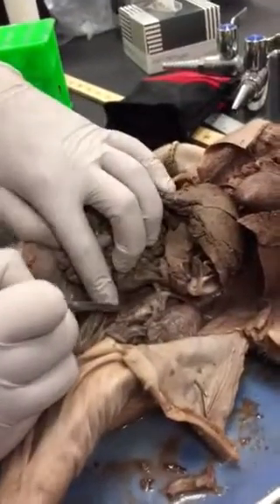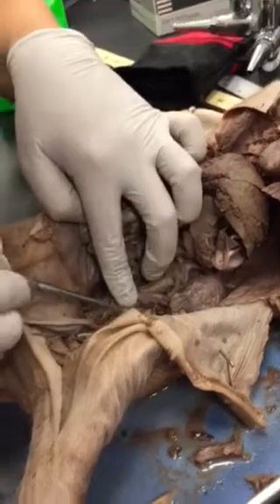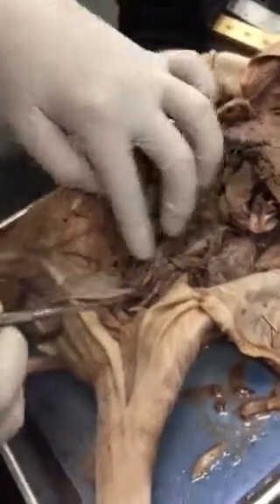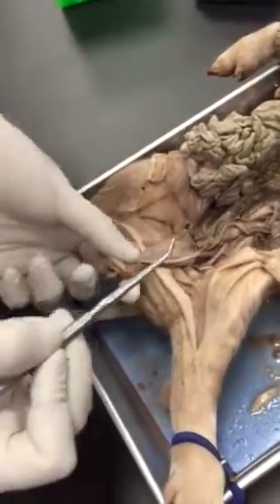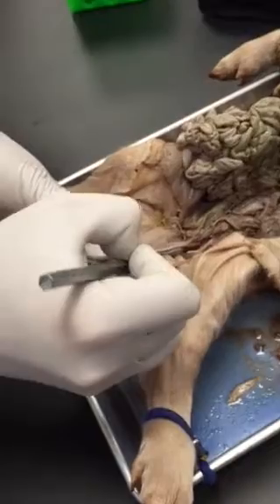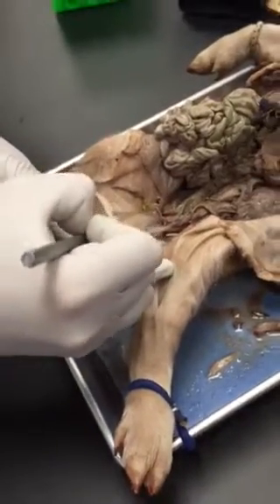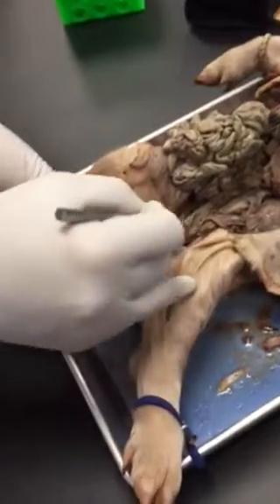So, okay, going back to the dorsal aorta, we're going to keep following, and now we see this branch here, right? And we also see these arteries shooting up this way, right? So this is your umbilical cord. What are these? Umbilical arteries, right? These are red, so they're arteries. They're coming off of the aorta.